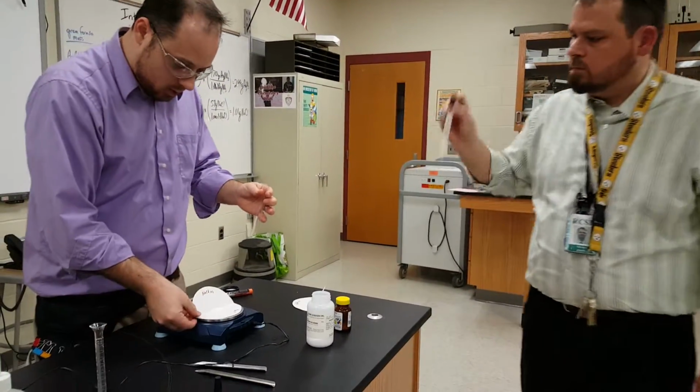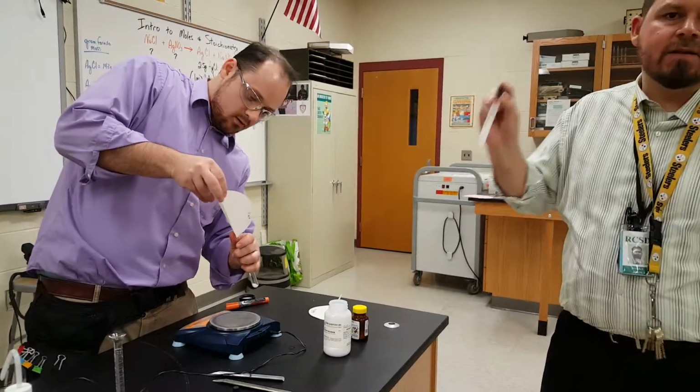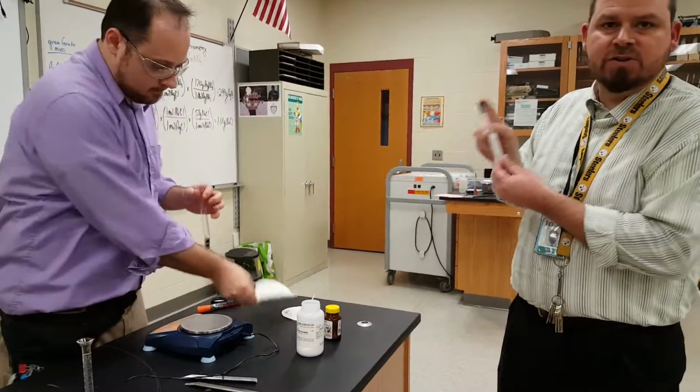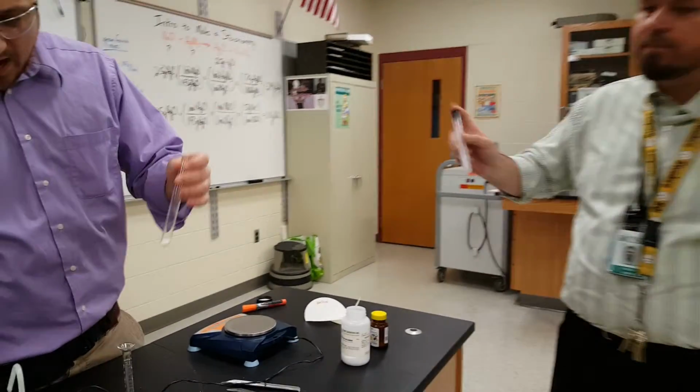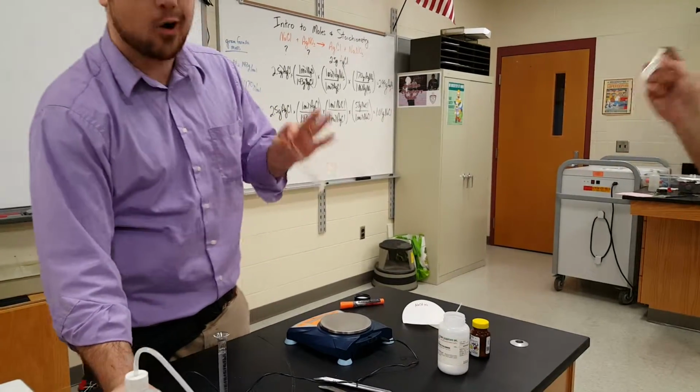This is sodium chloride. I'm adding it to a test tube, just like before. If we were to have extra in this reaction, we wouldn't want to have extra silver laying around. We want to use all that. And so I'm just going to give it a nice 10 mL squirt of water or so.